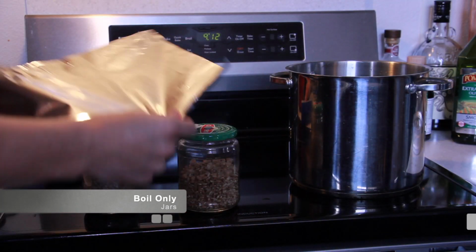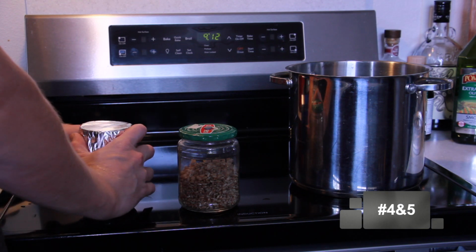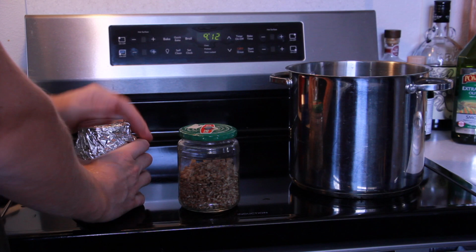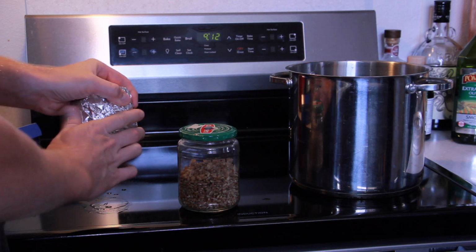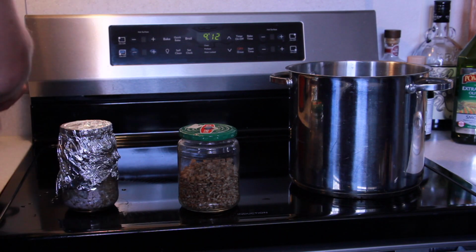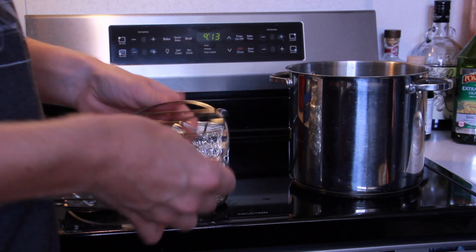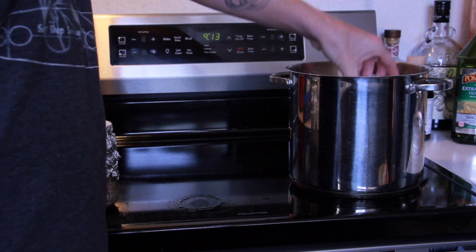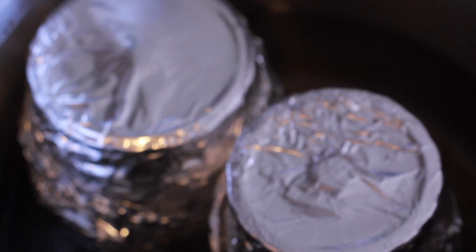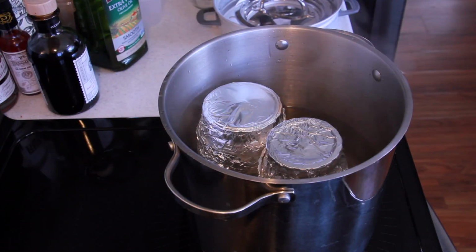For the 2 boil-only jars, I cover them with tin foil, and this is one thing that I'm not really convinced is required either, but kind of out of habit, it's something that I still do. I think in the future I'm just going to skip this step. So I put a trivet in the bottom of my pot on the stove at home, threw the jars in, got the water up to a boil, and then covered the pot with a lid.